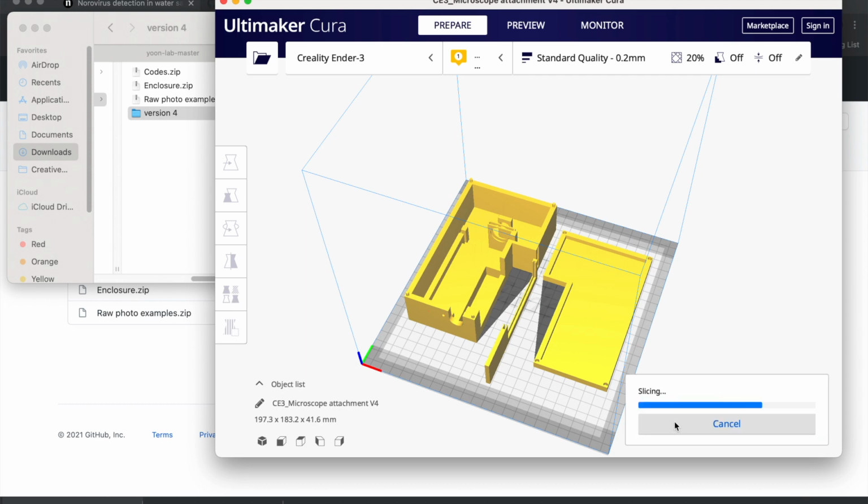I have my SD card for the printer inputted into the computer right now, so this would take 17 hours 8 minutes. That does vary depending on the printer and the settings you're using, but it's a good estimate. 130 grams. And then I would just go ahead and save to file, which I have already done. Just save to the SD card, plug it into your 3D printer, and then do normal setup and printing. You should be good to go.